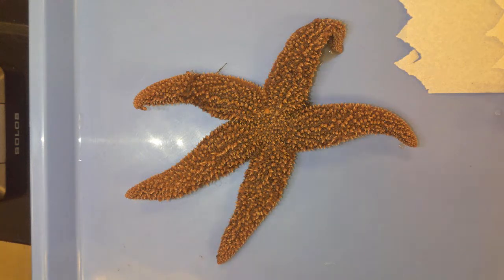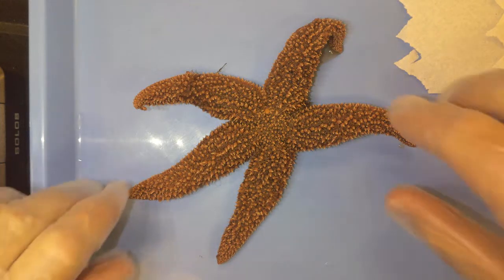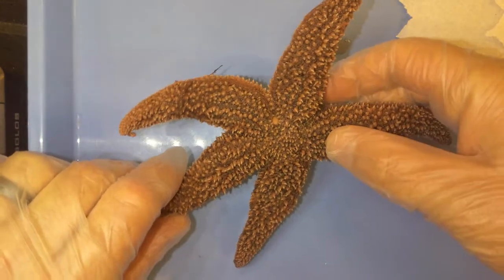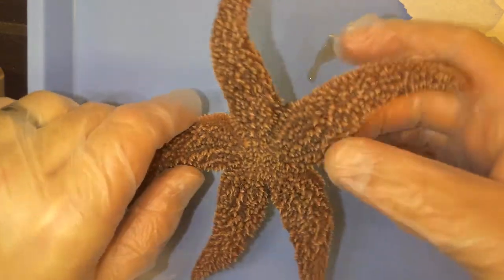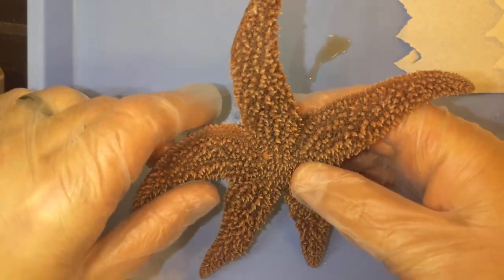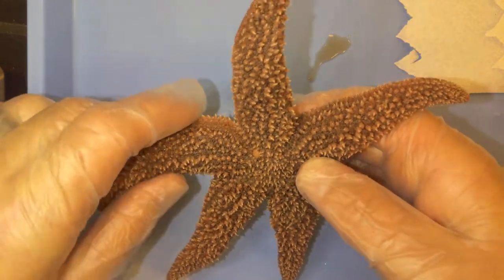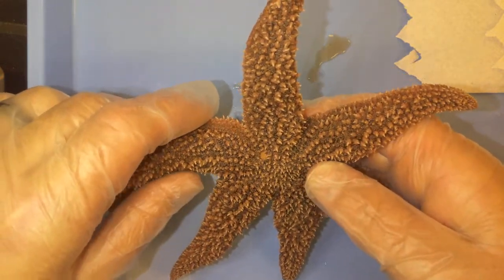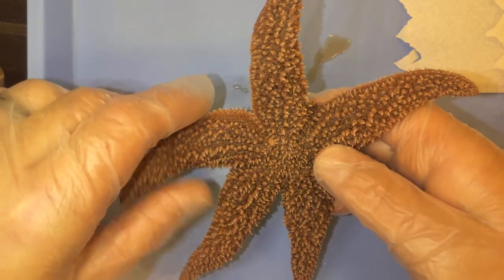Hello, everyone. We are going to be dissecting an echinoderm today, and this is a sea star. This animal belongs in Phylum Echinodermata, and the class that it belongs in is Class Asteroidea.